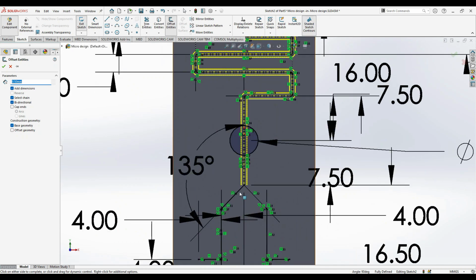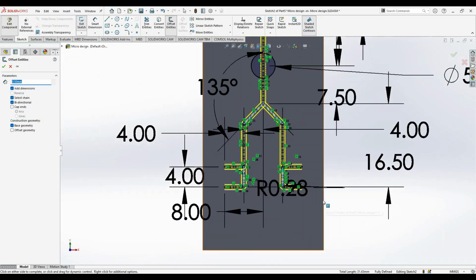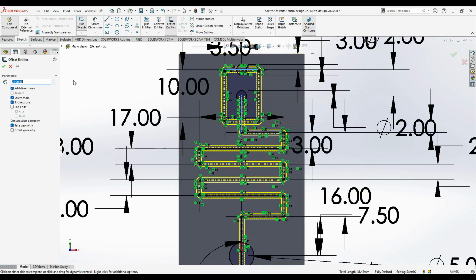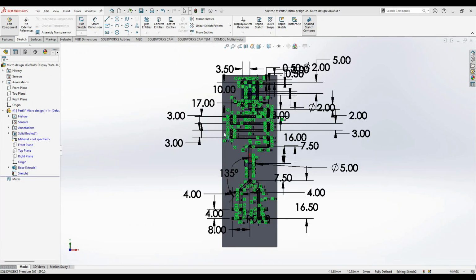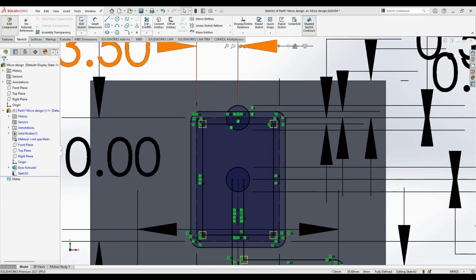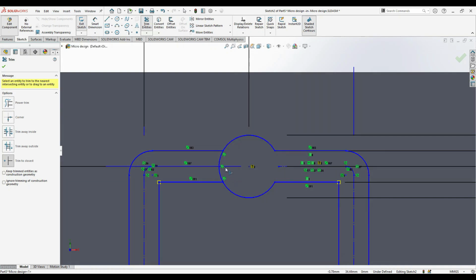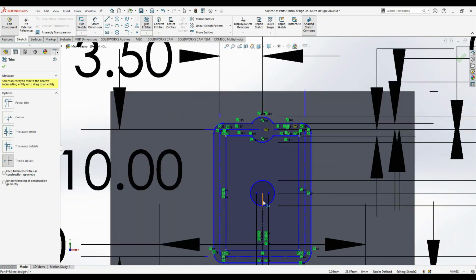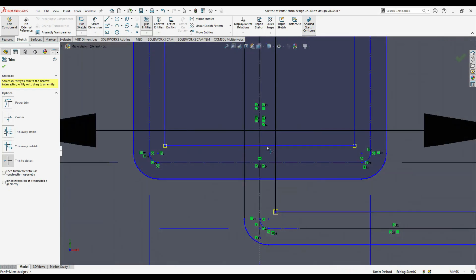You can see the formation of lines. Okay, now everything is selected and create OK. Now everything is done. Okay, now the next part remaining is the trim operations. So now we have to trim the entities which are not required. So you can see that you have to trim this and open the channels. Okay, don't worry that the constraints are gone, so that is the reason it is converting to blue. But further we have to give the constraints. I'm just trimming down and opening the entries.